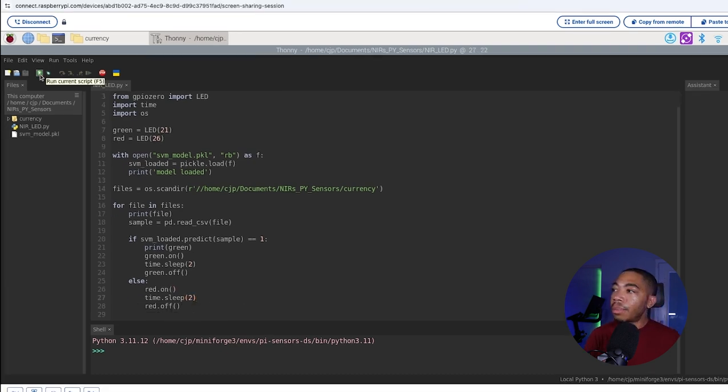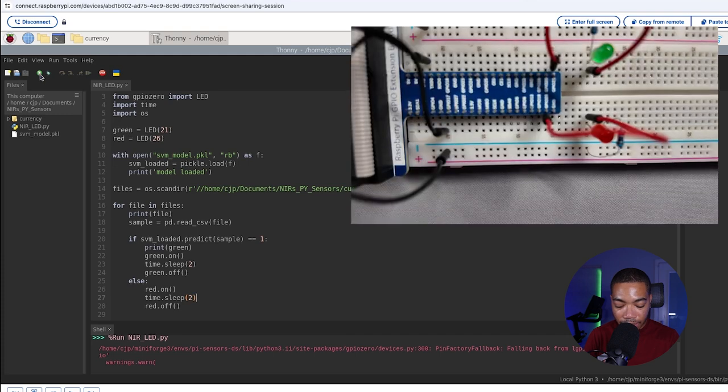To run this model, I simply just select run script. It'll run through the files, and you will also see what the LEDs would do in real time.